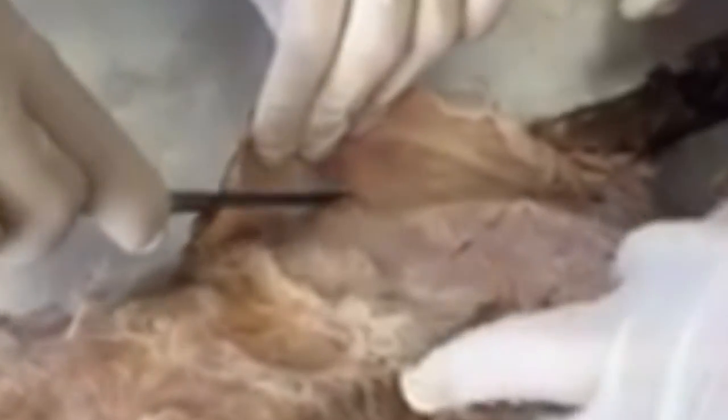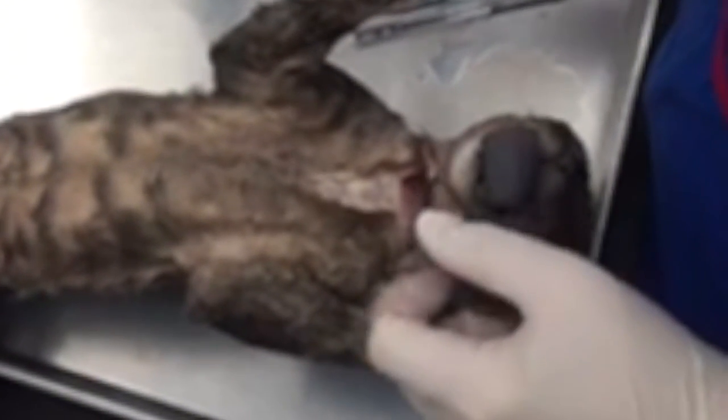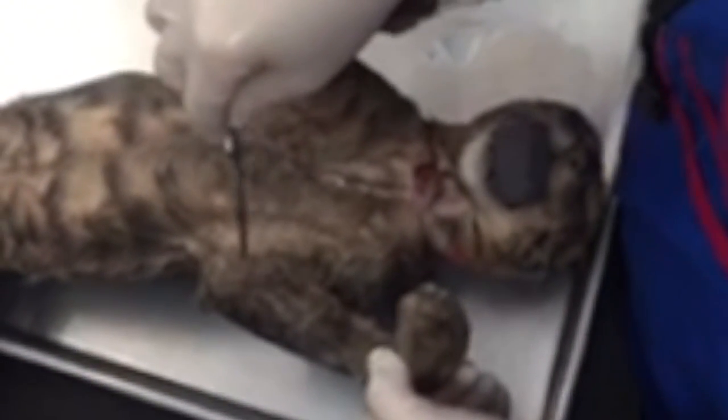As we dissected the cat, we noticed the cobweb-like appearance of the connective tissue that attached the skin to muscle. It was difficult at first to skin the cat, but after a while, we were able to successfully make incisions that did not cut into muscle. We have come to fully understand that the cat's skin is connected with other systems in the body, just like ours, especially with the muscular system, as we had to avoid damaging underlying muscles.